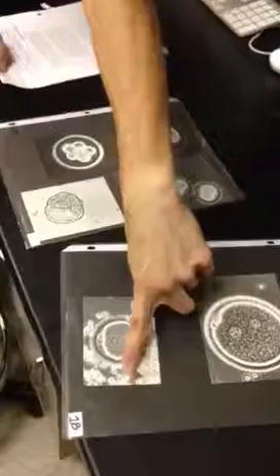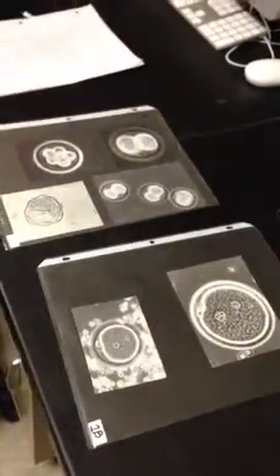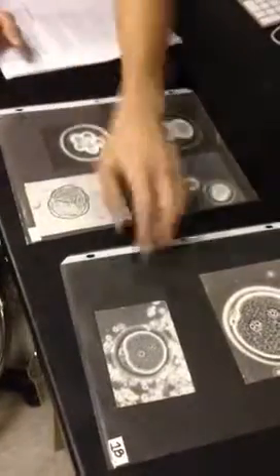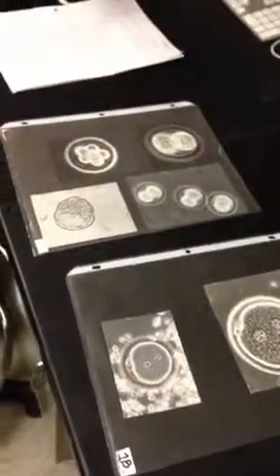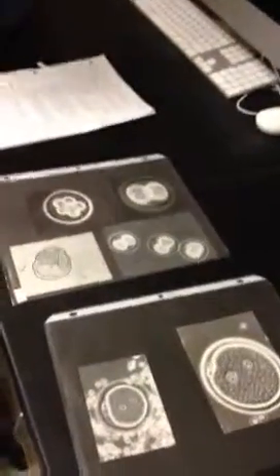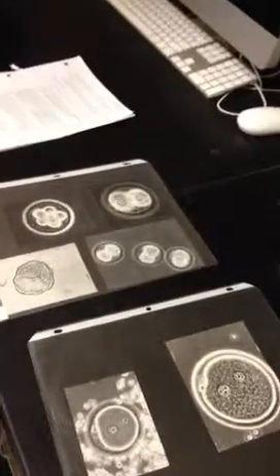What is this? The stuff around it? This whole thing is the same thing as this. These two are the same structure. They're both fertilized zygotes. Here, though, you're seeing what should be cumulus cells. When the egg is ovulated, it's not ovulated by itself. It needs to still be protected, and also have cells that are going to be doing the hormonal secretions around it as it's traveling in the fallopian tube. So these should be the cumulus cells that are ovulated with the oocyte. Because as the follicle expands, you have follicular cells most peripheral, and then the cluster of follicular cells just around the oocyte become the cumulus cells. And then this is just a zoomed in version of one of those.